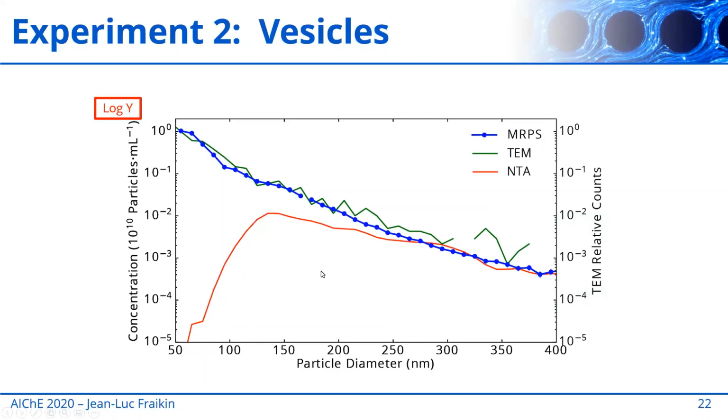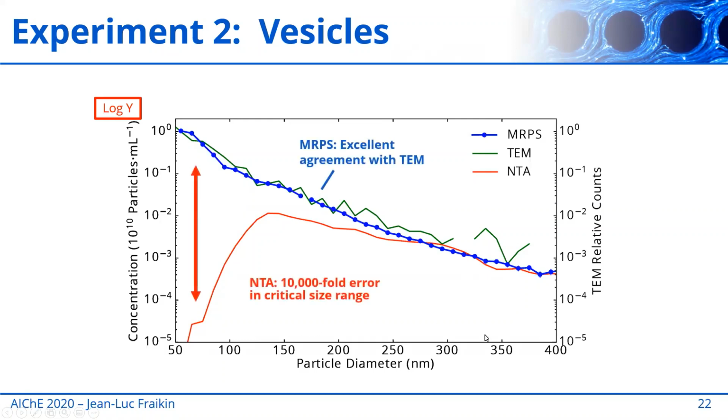Well, in the previous example that we talked about with the polystyrene beads, we saw that when there were bigger particles in the sample, which there are here, it's very difficult for NTA; it physically can't accurately quantify the small ones. And that's exactly what we're seeing here, essentially a sensitivity roll-off from NTA as you get down to smaller sizes. And for this kind of sample, these are vesicles. This is the size range of interest. This is a critical size range, and NTA is showing 4 orders of magnitude off in concentration.